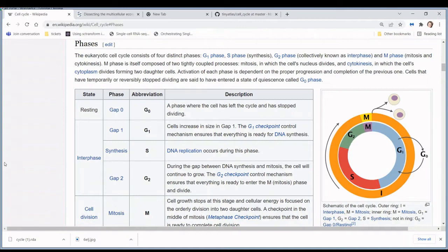How are we going to do this? Well, for each phase in the cell cycle, we have a set of marker genes, so a set of genes that are only expressed in that specific phase of the cell cycle. So you have marker genes for the S phase, and you have marker genes for the G2 and M phase of the cell cycle. In each cell in our data, we're going to check if these marker genes are being expressed, yes or no.